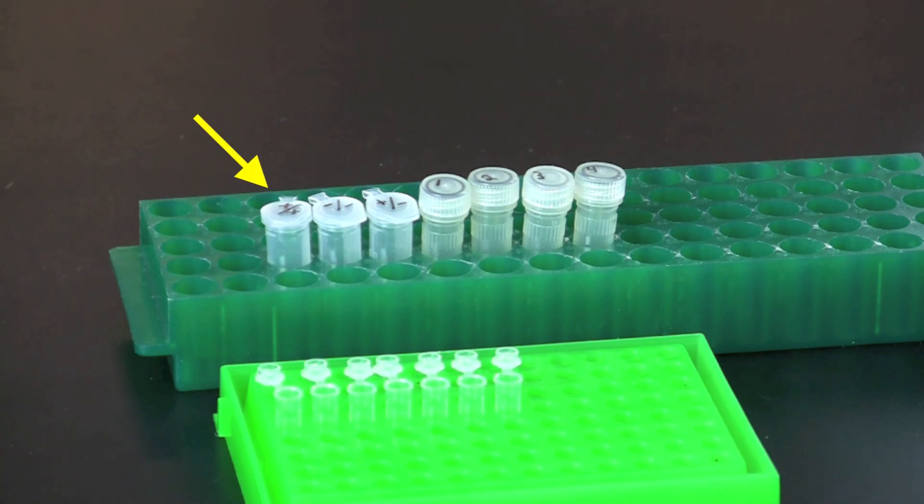A plus plus control, a minus minus control, and a plus minus control, and tubes with student samples.